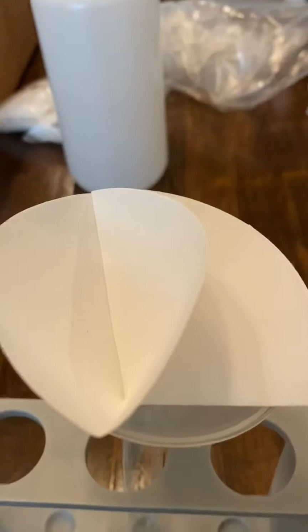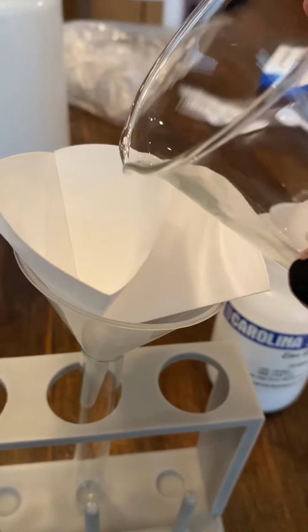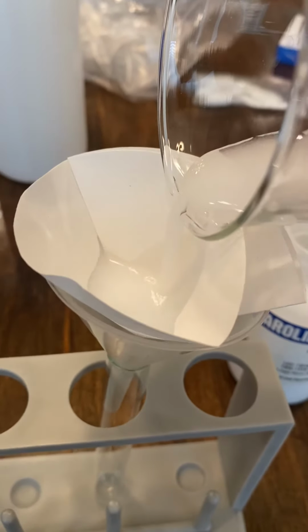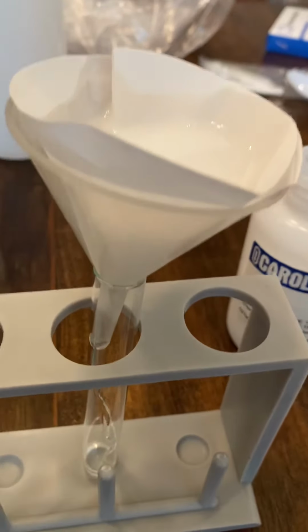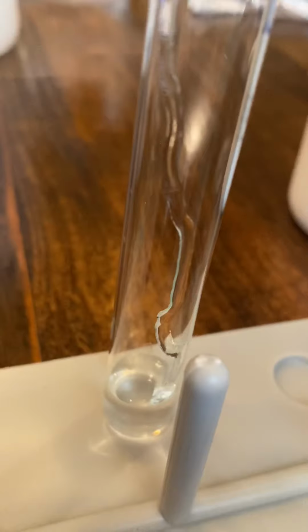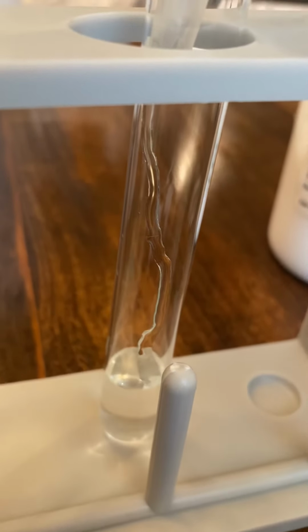All right, so I'm going to go ahead and pour in this mixture here. What do you think is going to happen? Is the same thing going to happen here as it did with the copper 2 sulfate? So I'm going to pour all of that in. Going in through the funnel. And take a look at what comes out below. Is it the same type of mixture, or do you think something was filtered out?